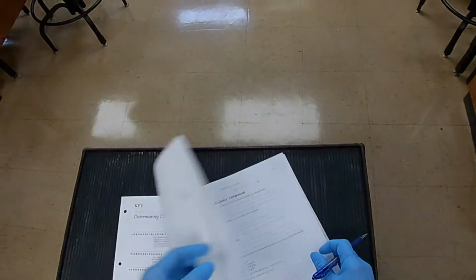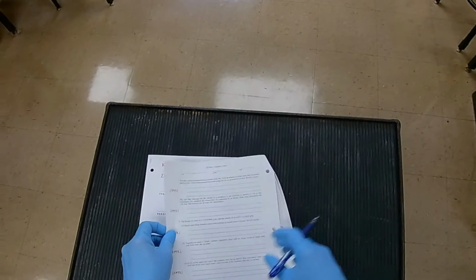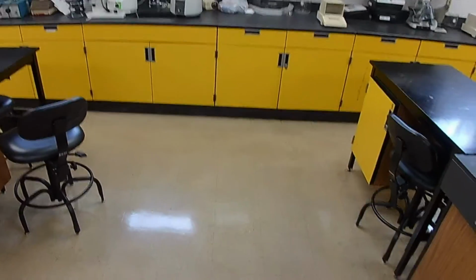Okay, we did the pre-lab already. Let's go back to post-lab questions. All right, I'll see if I can give you a little help here without actually feeding you answers. Compare the densities of your 2 rubbing alcohol samples. All right, so we did determine 2 densities for the rubbing alcohol, or the 2-propanol. Were they identical? Yes or no? And if they were not identical, why do you think they were different? Which means, what are the possible errors that could have been made to give you different numbers?